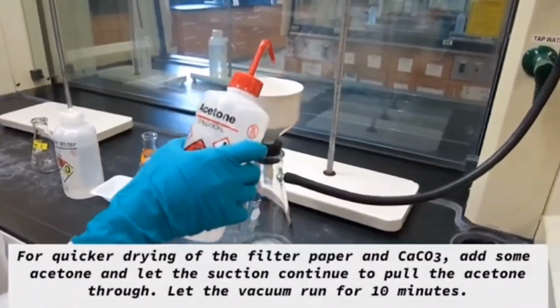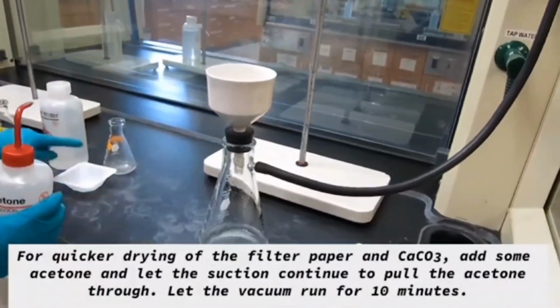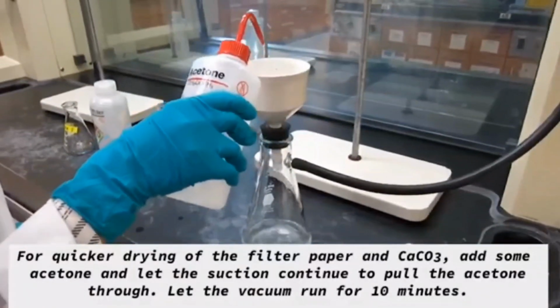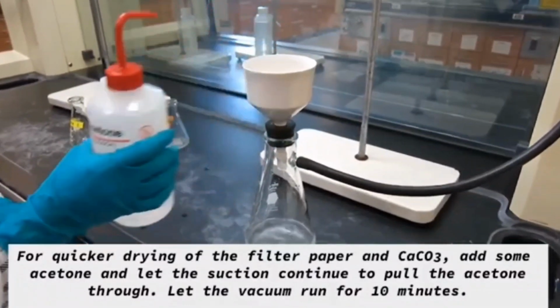And then after we filter our calcium carbonate, you can take about 5 milliliters of acetone and pour it over your calcium carbonate. That will help to dry the water fast.